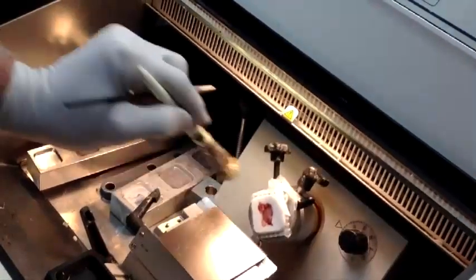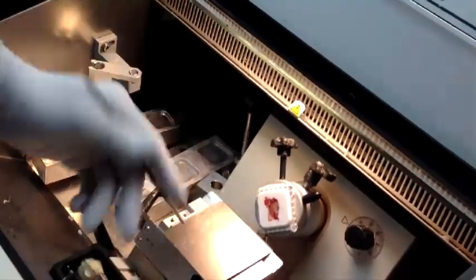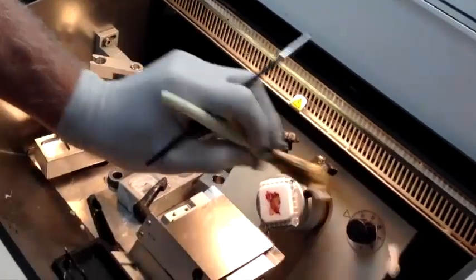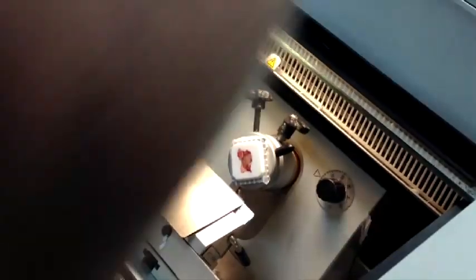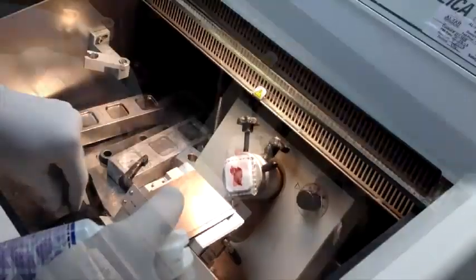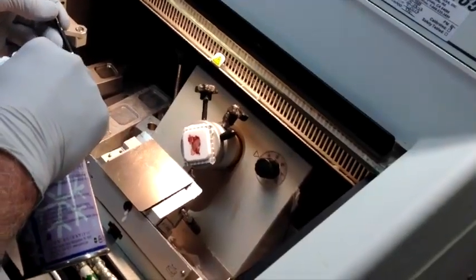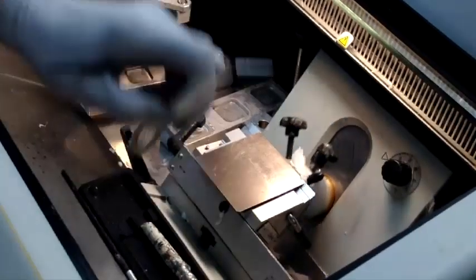I'll spin the wheel to get a feel for the consistency of the tissue. Is it frozen enough? What is the density? Is there fat on one side? Is there skin on another? Is it uniform in density? These factors will all help determine what adjustments to make. Now I'm going to take a look at a section. The brush should always be cold — put it down until you're actually going to take your section. If the brush gets warm, spray it. A warm brush will grab onto the OCT, melt it, and ruin the section.